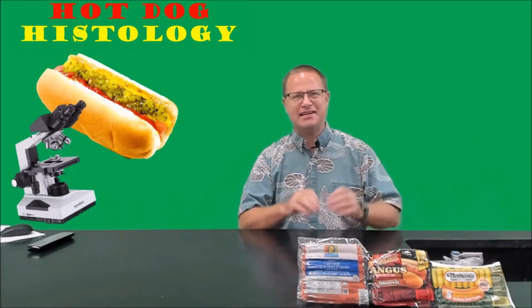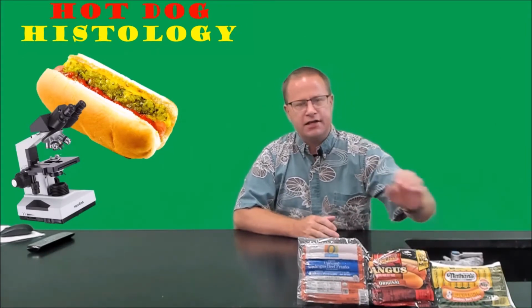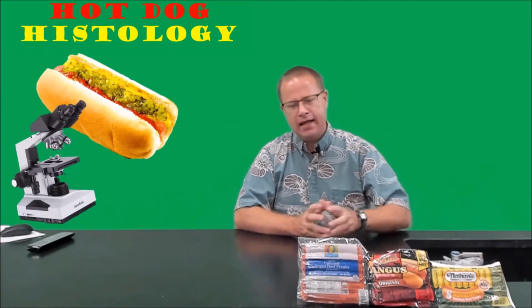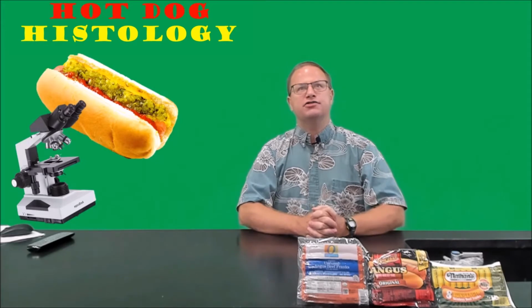Okay, now let's meet the contestants. The contestants are, of course, hot dogs. The first of these hot dogs is Nathan's bun-length hot dog. The next contestant is the Ballpark all-beef Angus hot dog. And the third contestant here is the Safeway Organics Angus hot dogs, which are uncured.